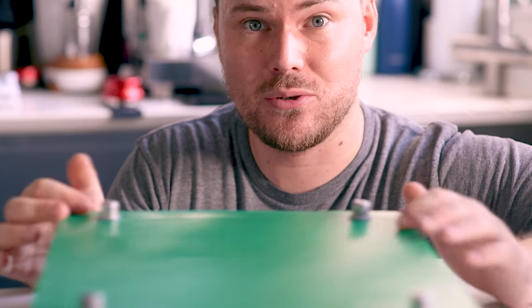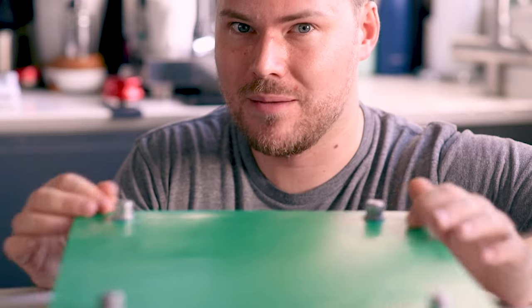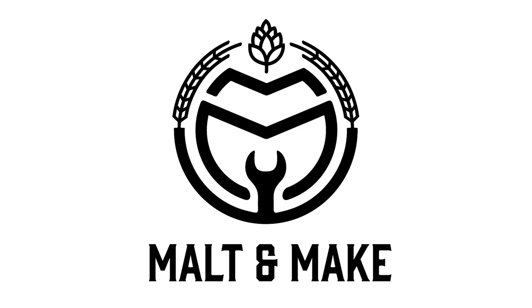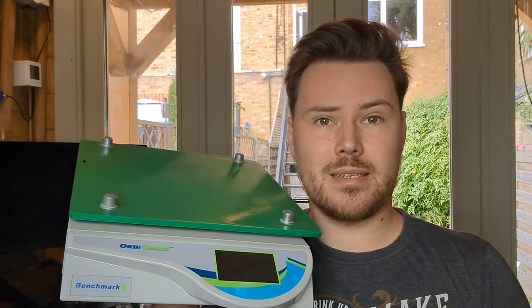Similar to airline or wedding or baby, things get expensive when you put that word in their name, but there is a solution. The word broken. So why did I spend 71 of my English pounds getting this delivered to me, a broken piece of tat? It all comes down to this.